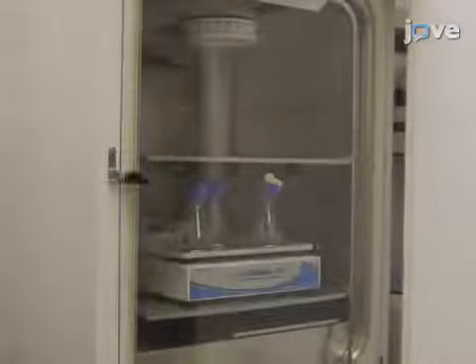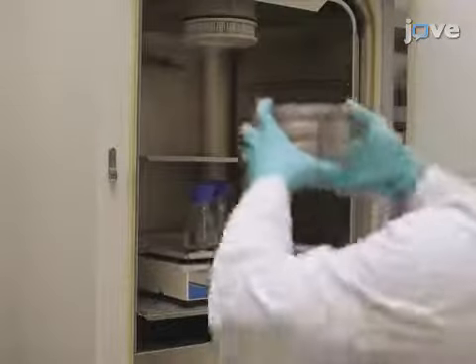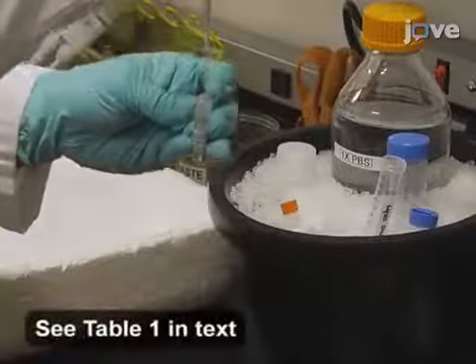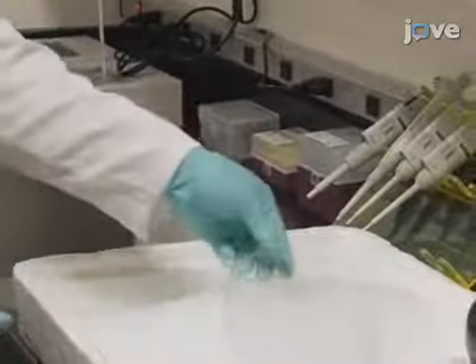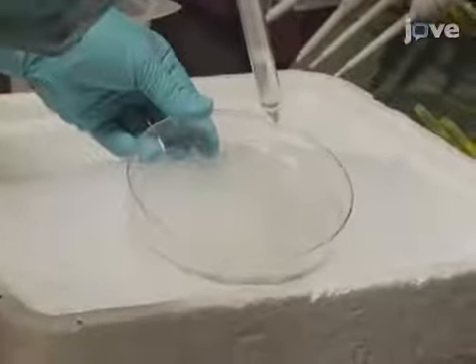Begin this procedure with preparation of A431 cells as described in the text protocol. Also prepare blaster lysis and dilution buffers with inhibitors. Pour off the culture media and place the cells on ice. Then, wash the cells twice with 10 ml of 1x phosphate buffered saline.